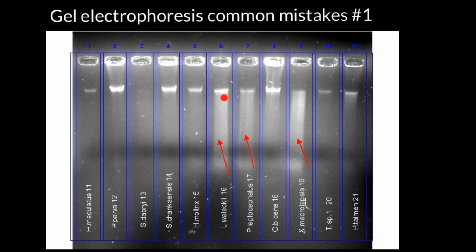Also, if we take a look at this smear, we would see that if our wells are here, our DNA moves in this direction, and this smear moves faster than our bands where most of the DNA is present. So this tells us that here we have DNA which is smaller in size, so probably our sample is also contaminated with DNases, which shear our DNA, and smaller pieces are present here.